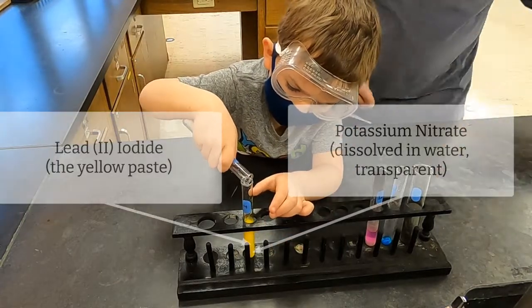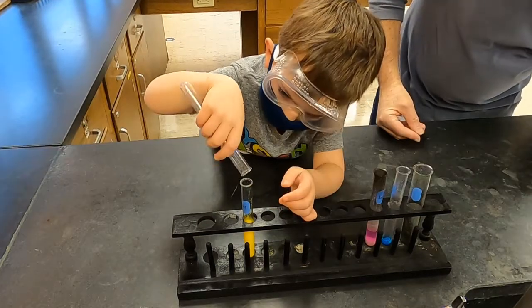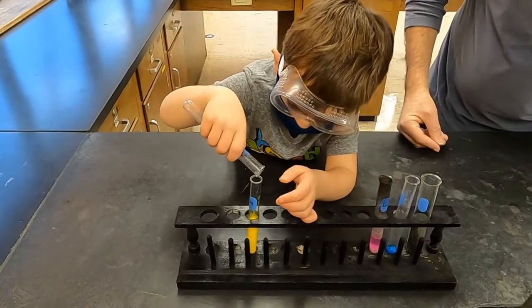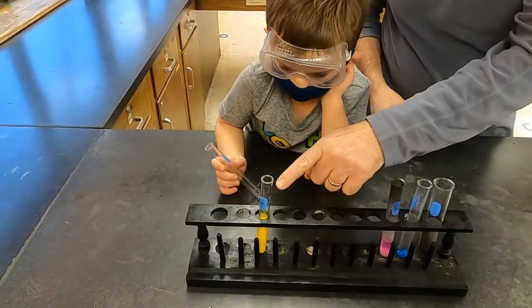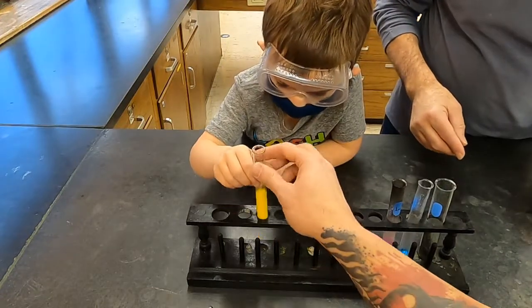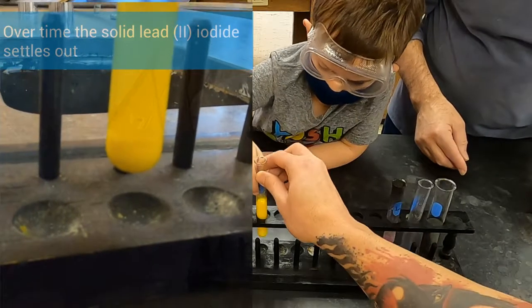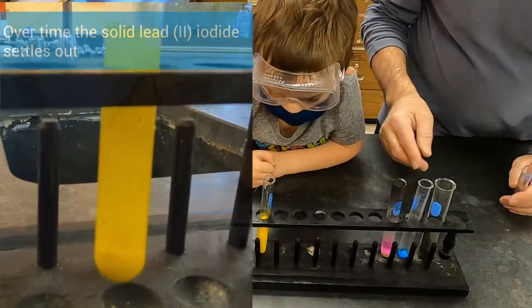And you get this bright yellow product. The yellow product, it looks like it's all throughout, but if you let it sit over time, it does settle out and could be completely filtered out, and you would have just a clear liquid. The clear liquid wouldn't be only water, it would also have the other product, the potassium nitrate.